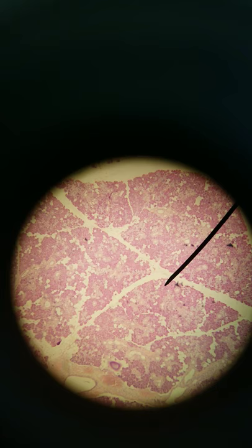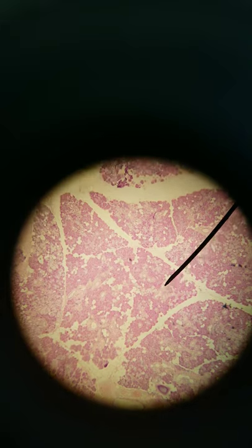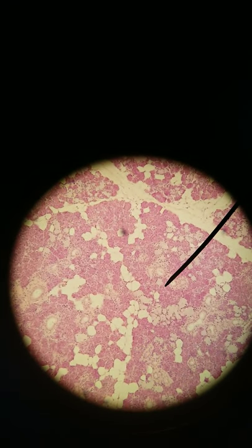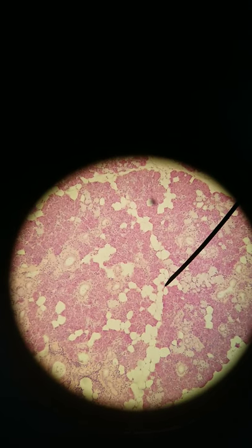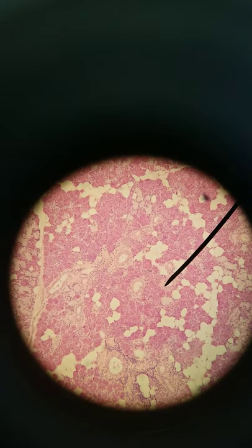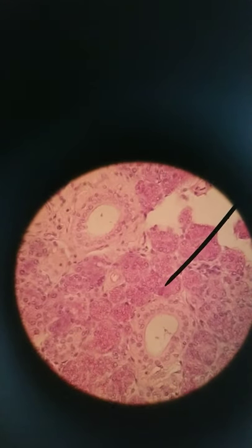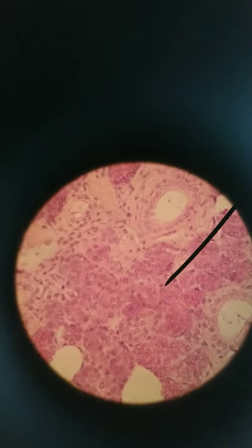We're at 40x, and hopefully right now you can already tell — some are lighter where the arrow is, some are a bit darker. We have a mix of serous and mucus. Serous is darker, mucus is lighter. The really light colored ones are adipocytes, and then these ones here are ducts. Where you see clusters of cells, those are acini. Where the arrow is right now, that's a serous acinus.